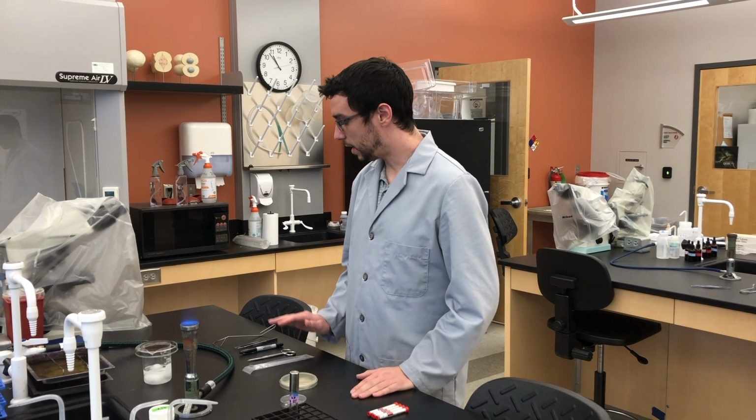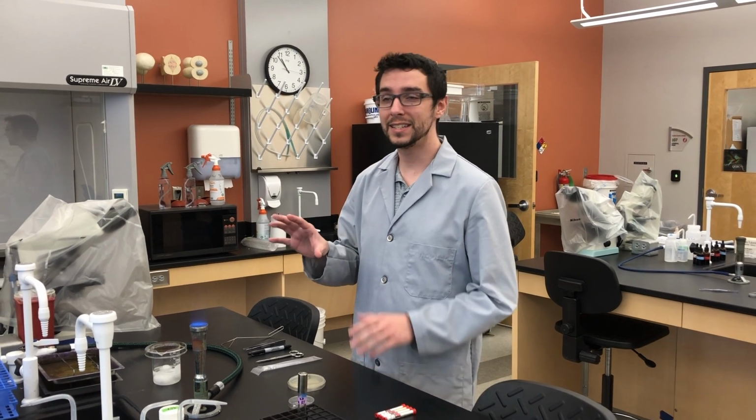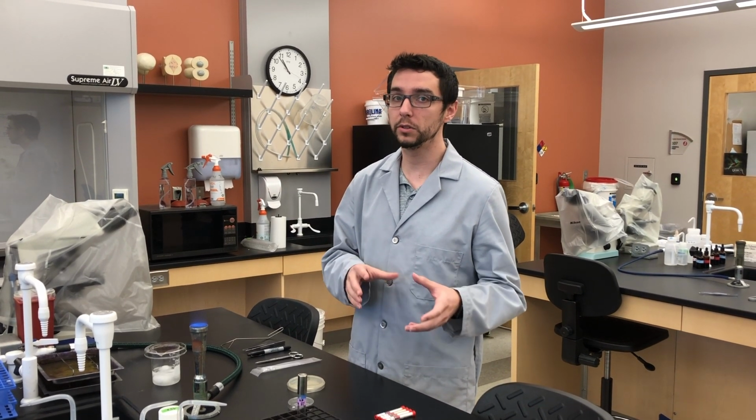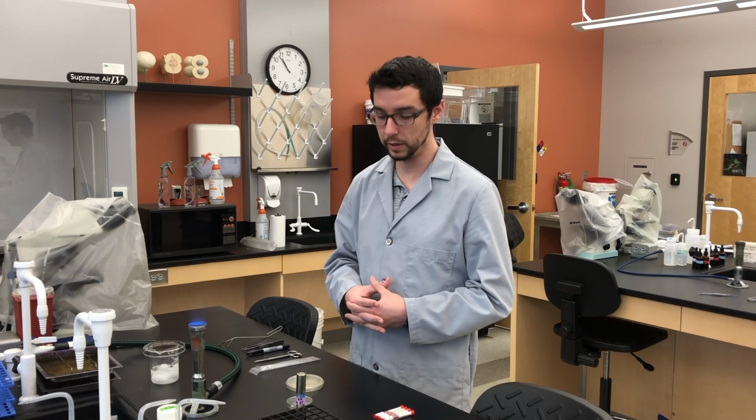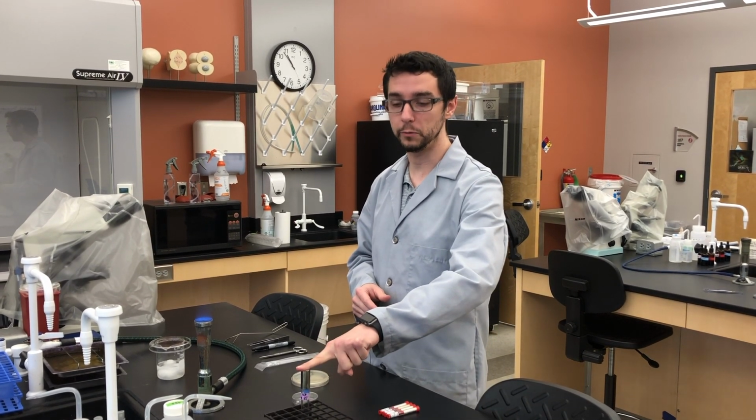Howdy folks, and welcome to this microbiology video where we're going to talk about antibiotic sensitivity with different sets of antibiotics. Now first, to do that, we're going to need to create a lawn. Now this is similar to but different from our serial dilution spread plate that we've done previously. The key difference is that we're not going to dilute out our culture that we've made.